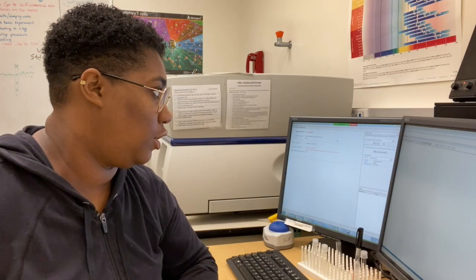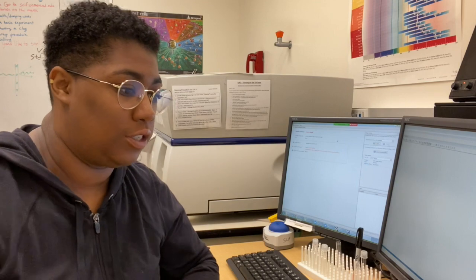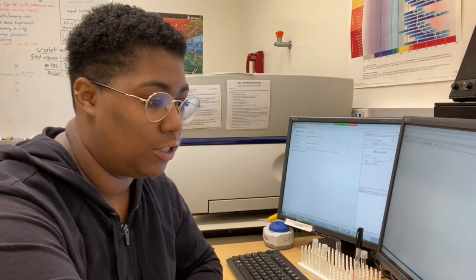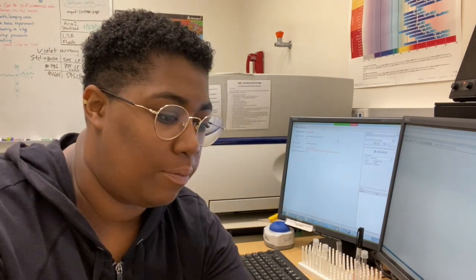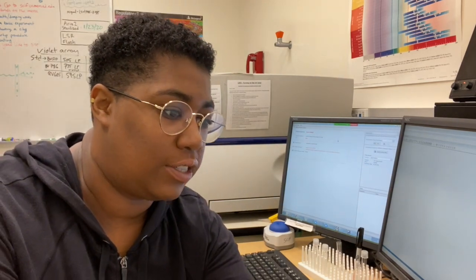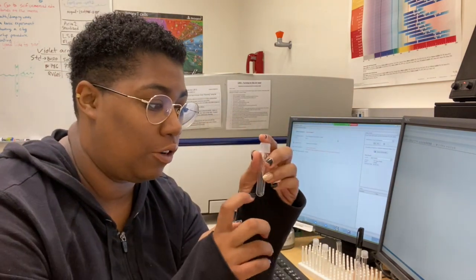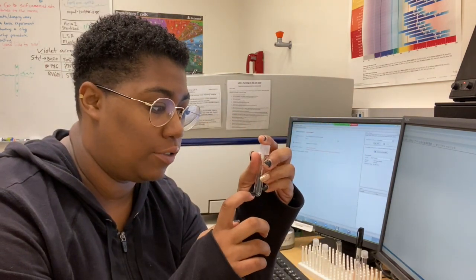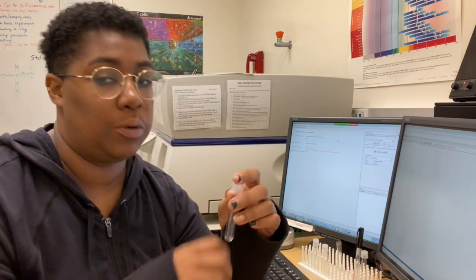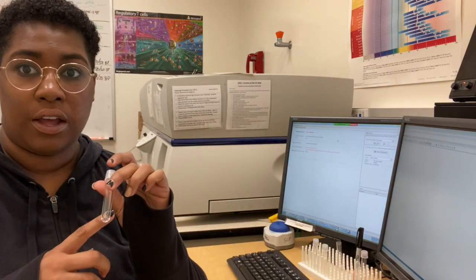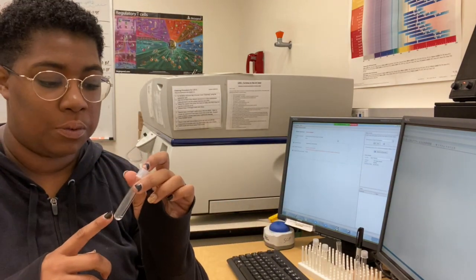The next thing you want to do is go into our fridge and grab the vial that says CST on it. If this is not in there or there's a little bit left, you want to grab a whole new test tube.